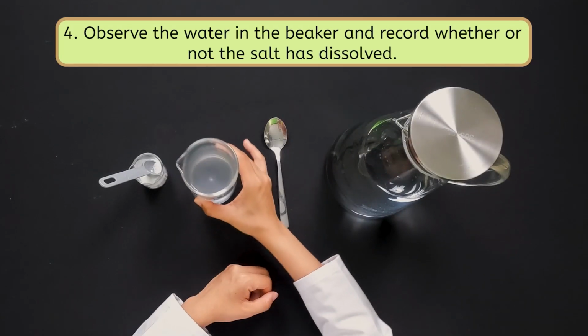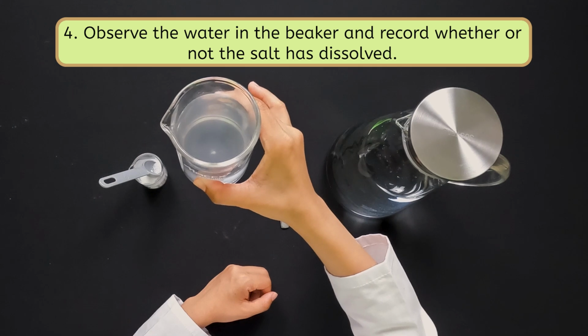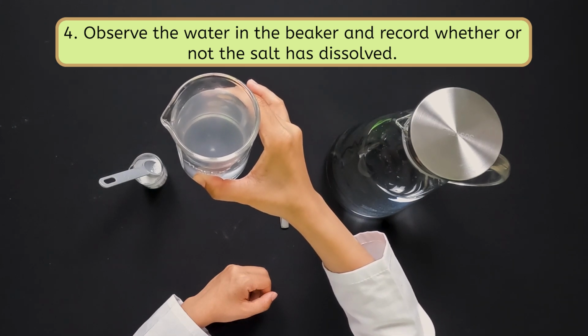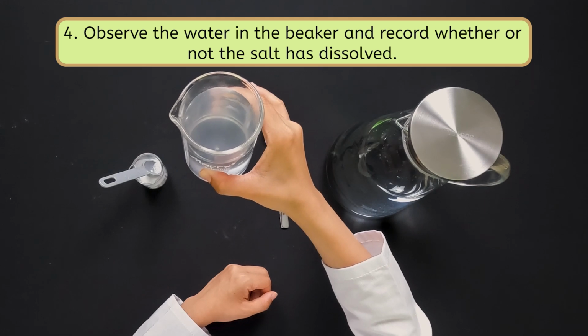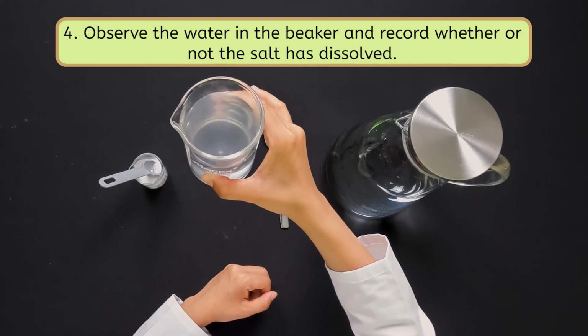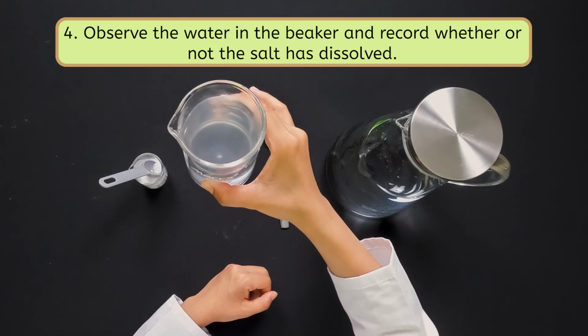Now it's time to make some observations. Observe the water in the beaker. Did the salt dissolve? When something dissolves, it means that the solid, in this case salt, breaks down into particles so tiny that they're no longer visible and they mix completely with the liquid, in this case the water. Pause and record your observations in your interactive lab notes.